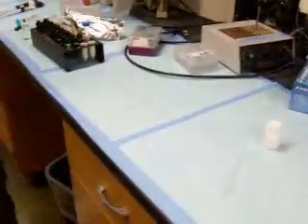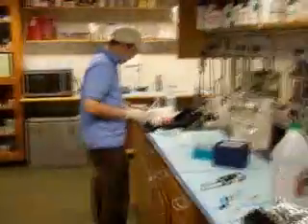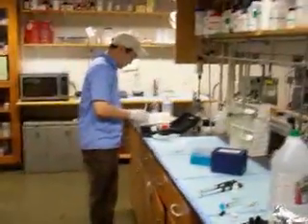Well, that appears to be a job well done. We'll have to get someone to change the diapers. Okay. Because you're a true hero, Andrew has volunteered to change the diapers. This will go to solid waste. Nice. Well, I think we're going to have to sign off.